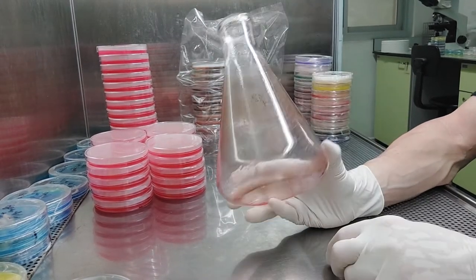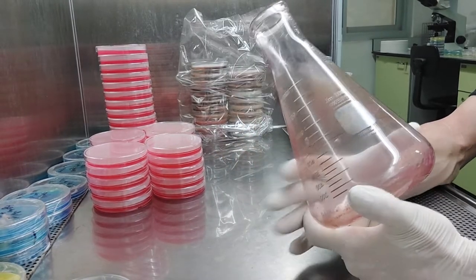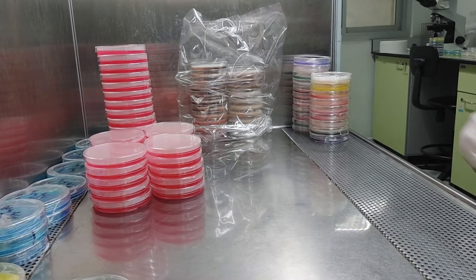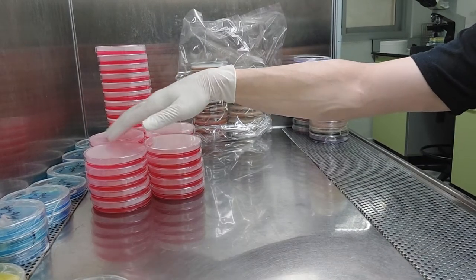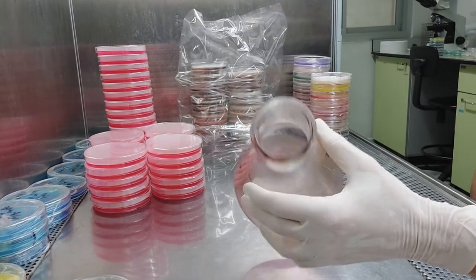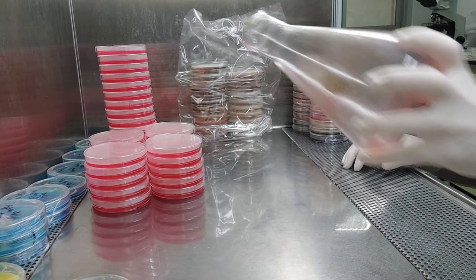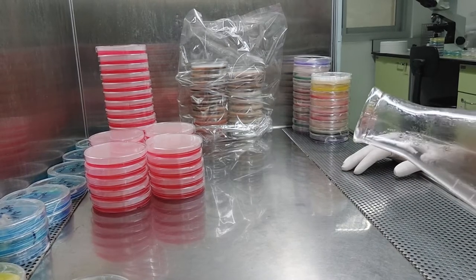I don't really care about clear agar. Anyway, that's the deal. Notice how I kind of did that little dip — when I go from plate to plate, I don't want to drip. So that little flick, that's exactly it. When moving from plate to plate, tip the flask slightly to cut off the pour cleanly so you don't drip between plates. Get this in the water as soon as possible — it'll clean up easier.